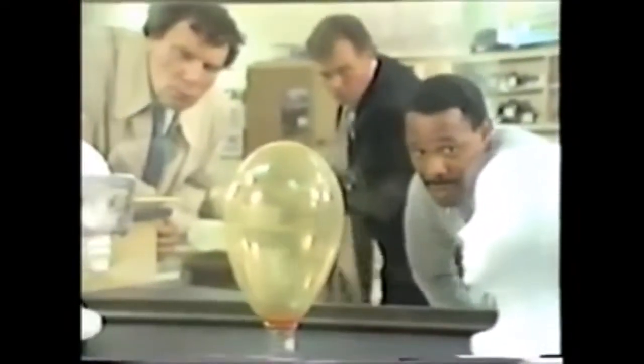Here's a little demonstration. I show my acetone, red dye, and hydrogen. The head's a styrofoam.